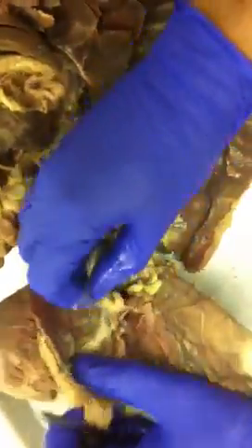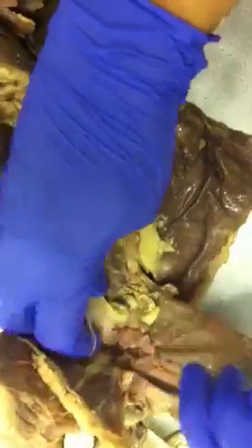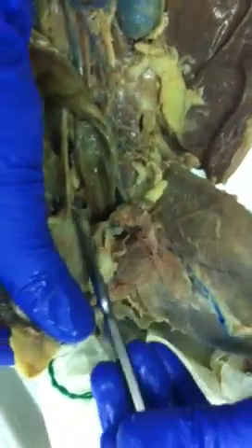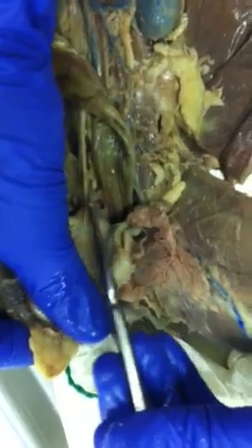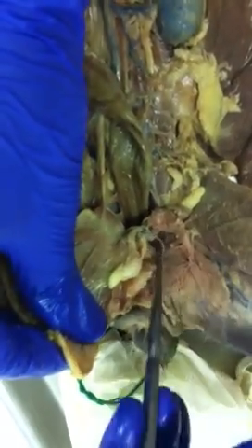You have urinary bladder. I'll go through reproductive while you're doing it. So since this is a male, here's the bladder. The urethra, if I pull on this, you're going to see kind of like a little point at the end. That's the urethra there. And in the male, you have vas deferens. So right here. They're on both sides, kind of on the sides of the fat pads and on the bladder.